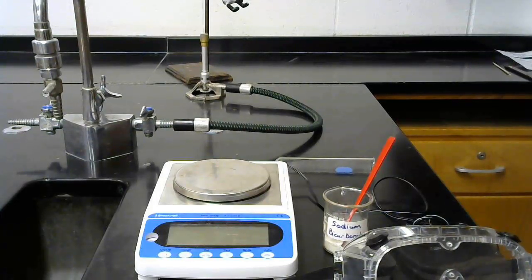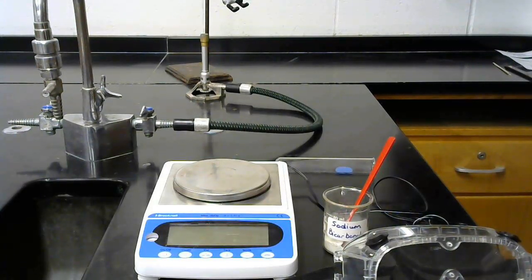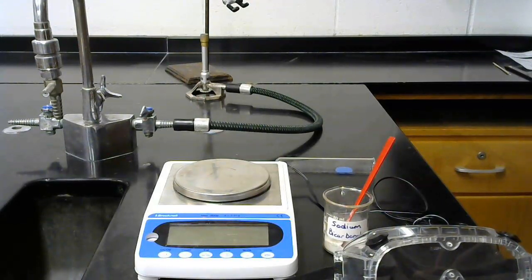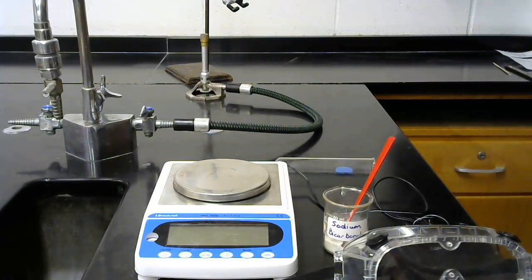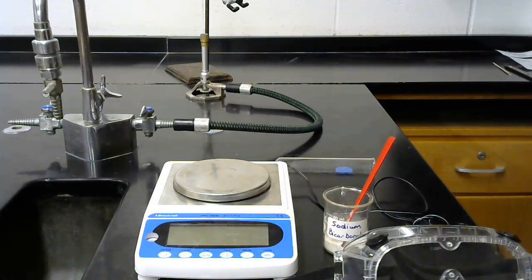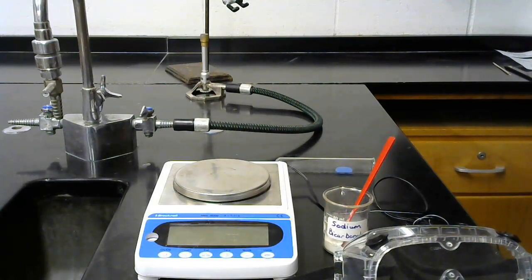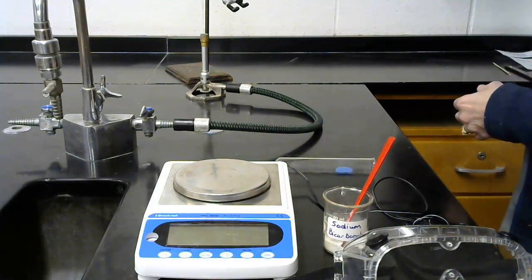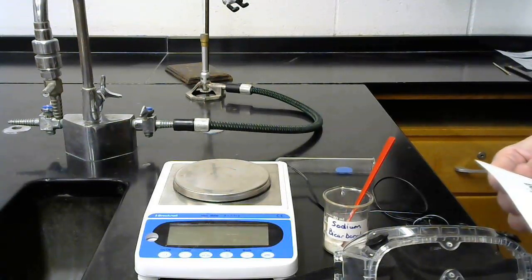We're going to start our first virtual lab. This is on the heating of sodium bicarbonate, or we could call it sodium hydrogen carbonate. I'm going to go through and show you some masses, and then you will record those in your lab notebook by making a data table. And then you need to go through some calculations at the end of this to figure out which equation matches the reaction.